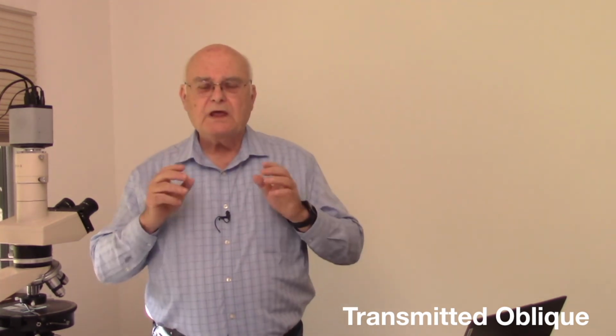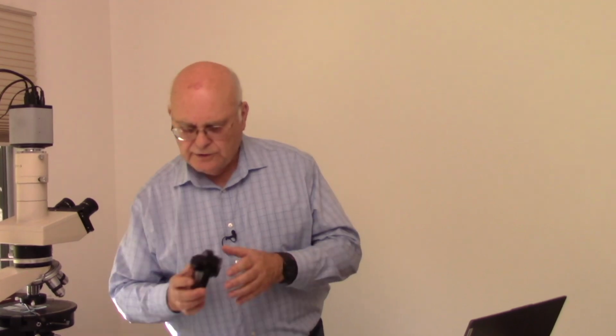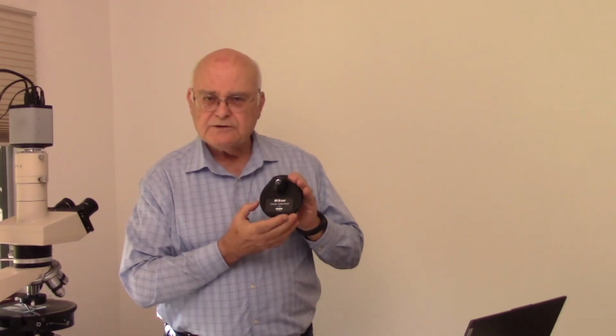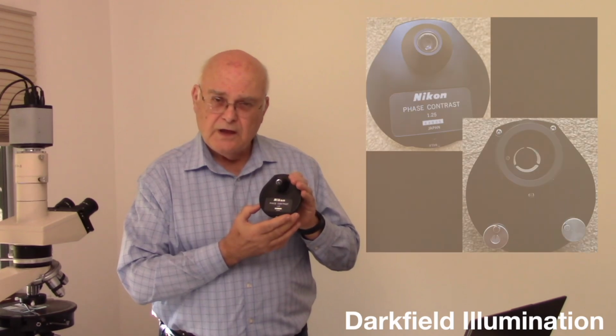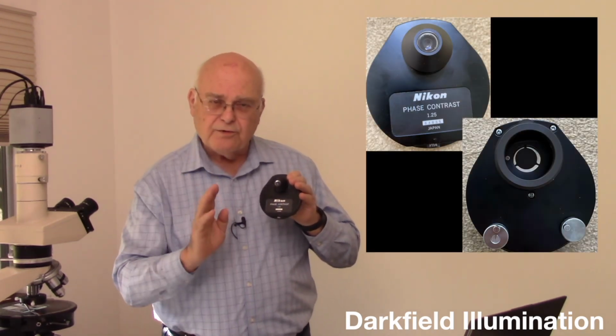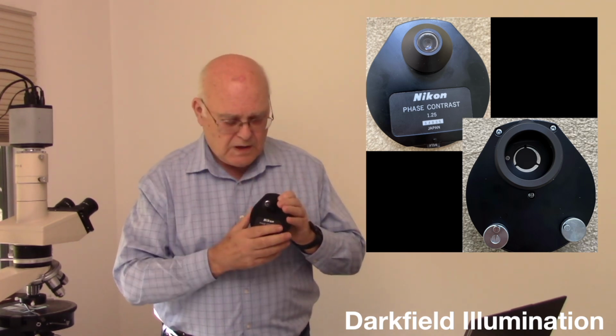Next step is to use dark field illumination. Now, with dark field illumination, again, what we do is we rotate in one of the stops in our phase turret that blocks all the light that can come directly through to our objective.